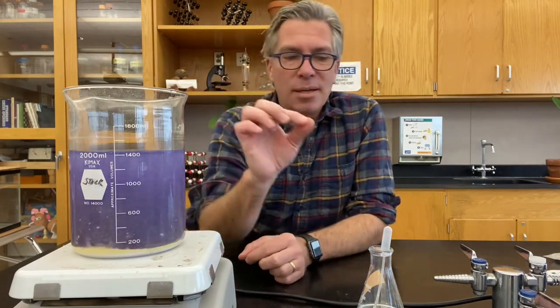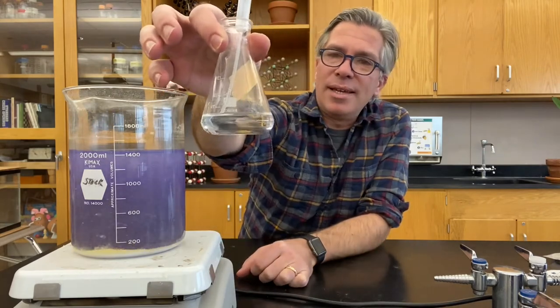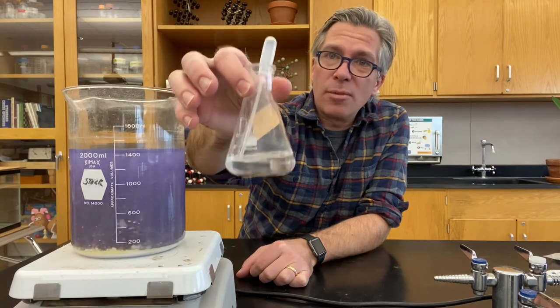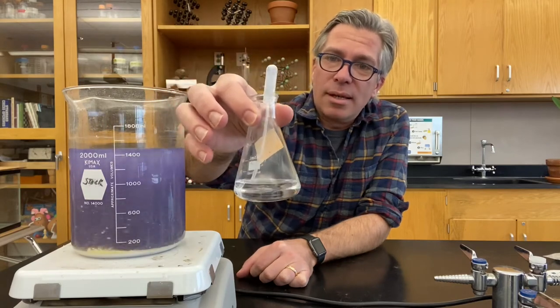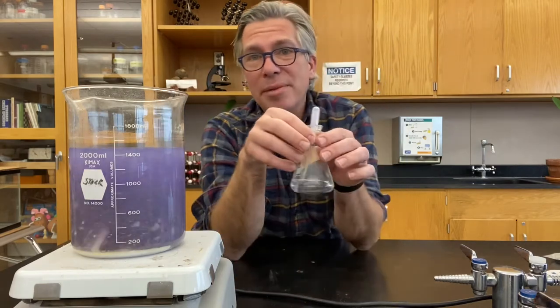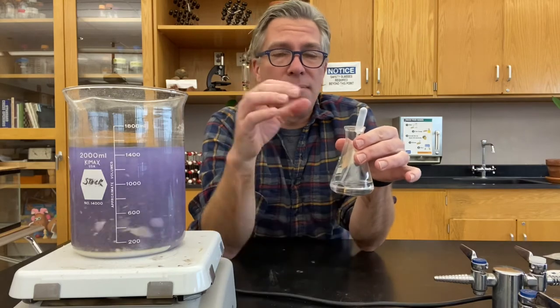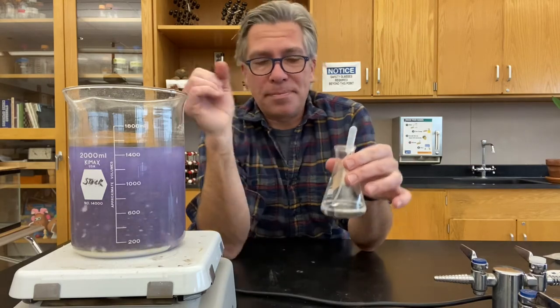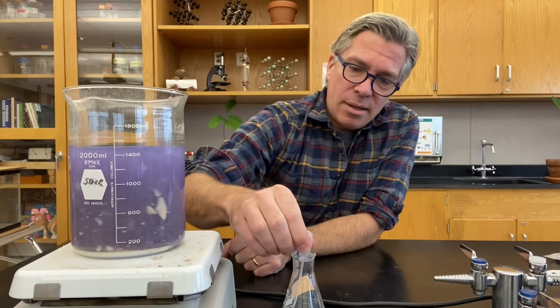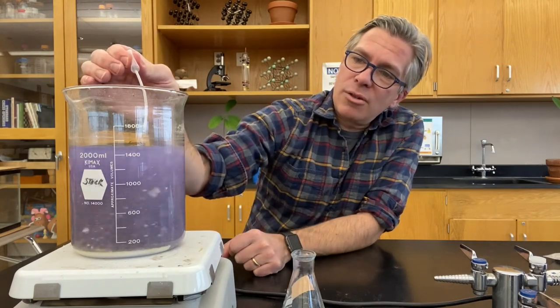I'm going to take some concentrated hydrochloric acid. It looks like water but it is definitely not — this is 12 molar hydrochloric acid. You really want to be careful with this stuff. You probably want to compliment it and say a couple of nice things because you really don't want to make it angry at you. And I'm going to go ahead and take a little squirt and drop it in.